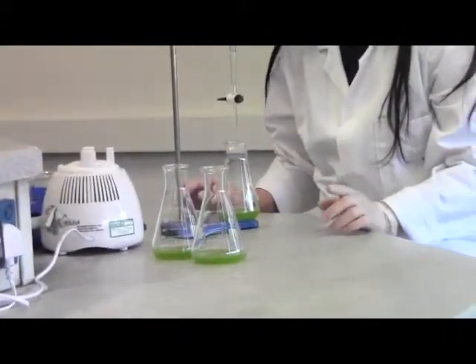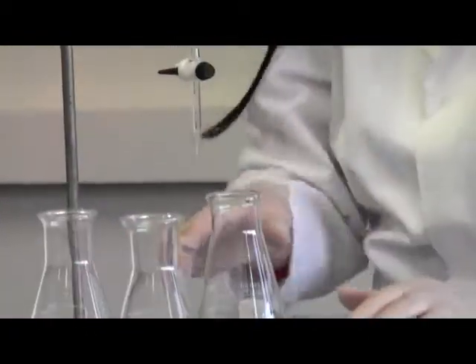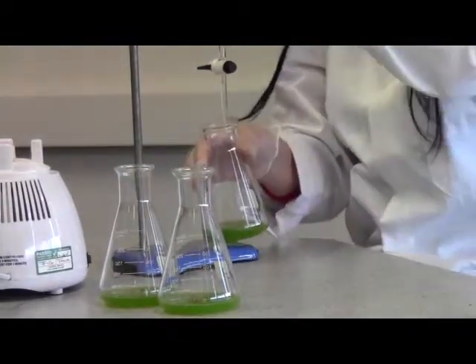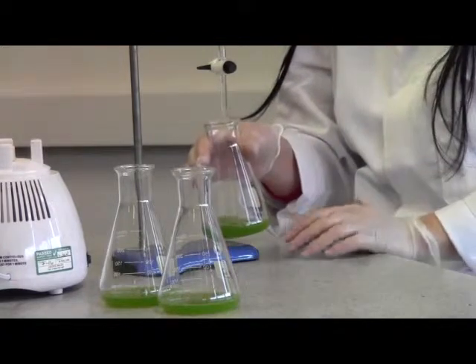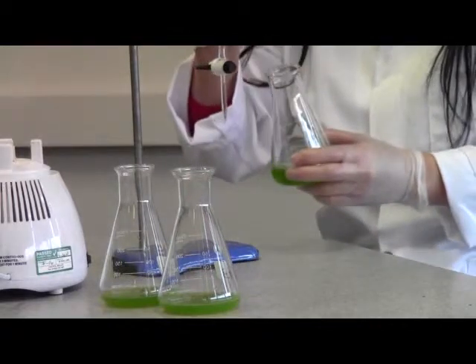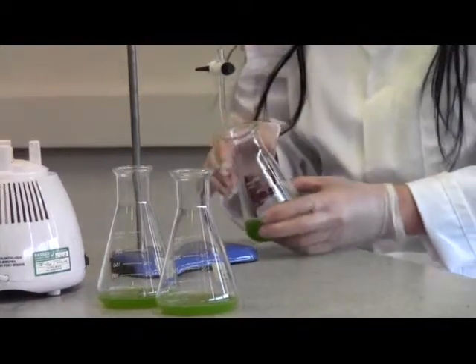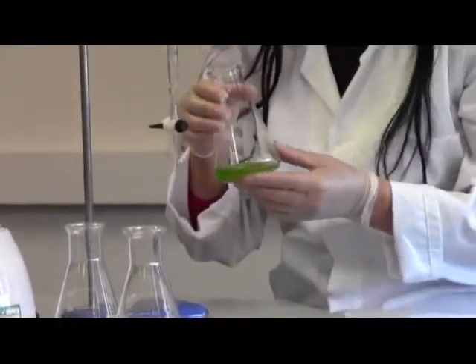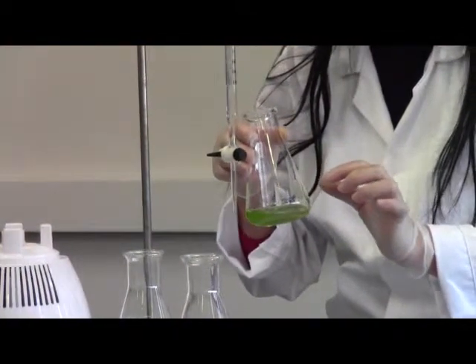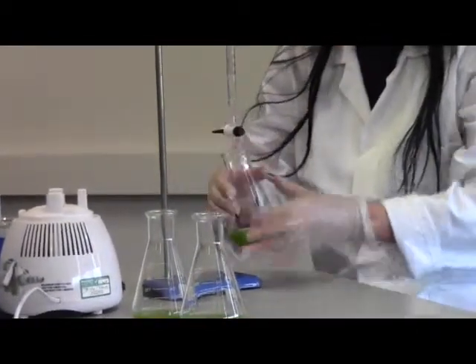Now, I have to state, for the first test, you could quickly scan, knowing roughly how much volume you are going to use for titration. In this titration, the starch is going to react with iodine and become blue-black color. Once the permanent blue-black color is made, that's the end point. So we are going to test.